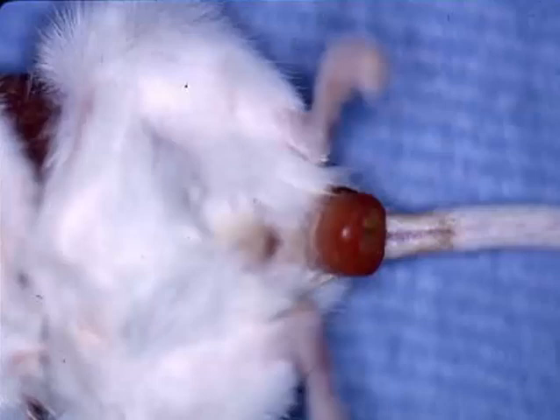Finally, rectal prolapse. We mentioned at the beginning of this lecture that the rectum of the mouse is not anchored by serosa. It tends to be sort of movable, so a lot of these particular diseases that we have talked about in terms of diarrhea can result non-specifically in rectal prolapse, including Citrobacter rodentium, E. coli, Helicobacter, enterotropic mouse hepatitis virus, and the rare cases of pinworms.